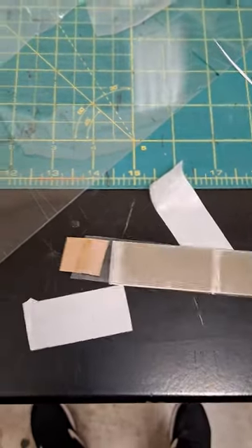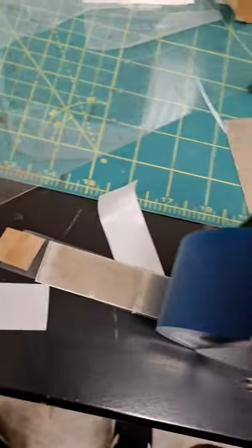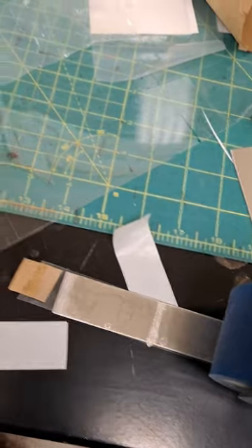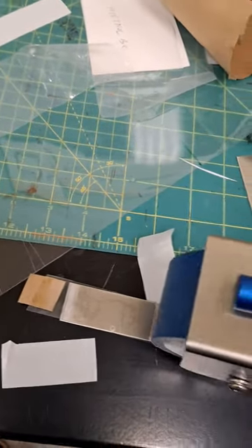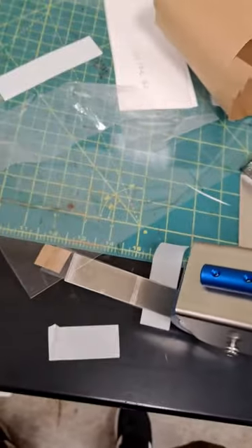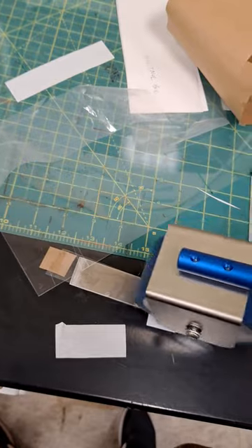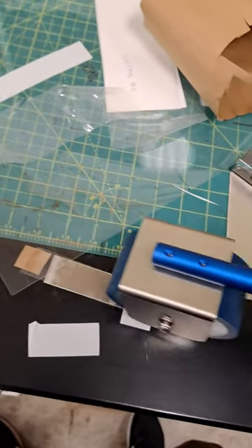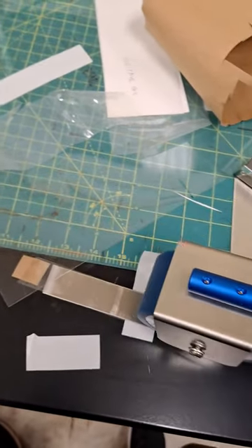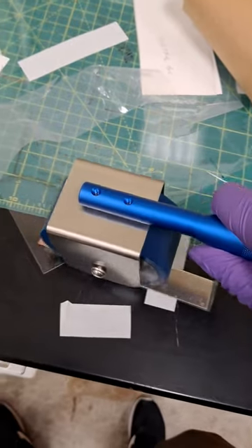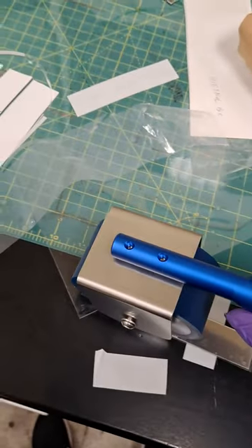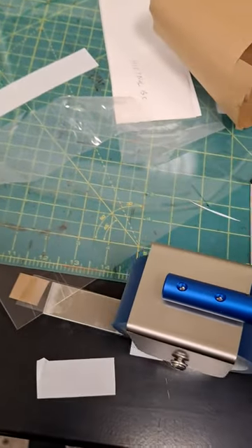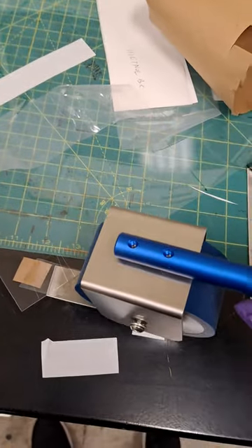Then use the roller: 1, 2, 3, 4, 5. Some people use 5 rolls, some use 10. It totally depends on you.